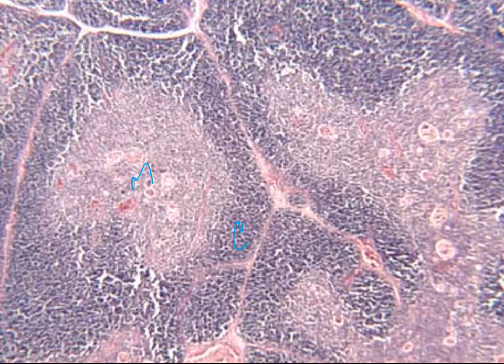So whereas the islets of Langerhans in the pancreas didn't really have a whole lot as far as numbers of the islets, here they make up a relatively large component to them. That's there, and so the different tissues that are there within change kind of the components that are there for us to be able to see on there. Depending upon whether we're looking at a young thymus gland or an older thymus gland, is going to kind of change the lobules and kind of the space in the septum in between.